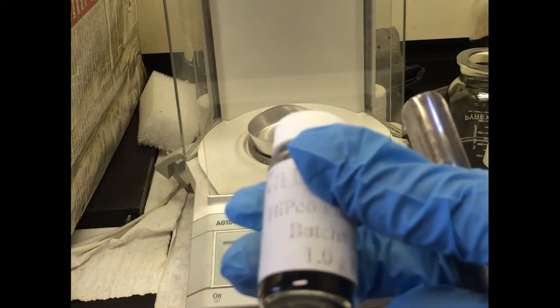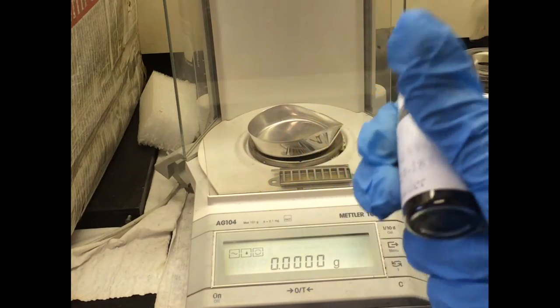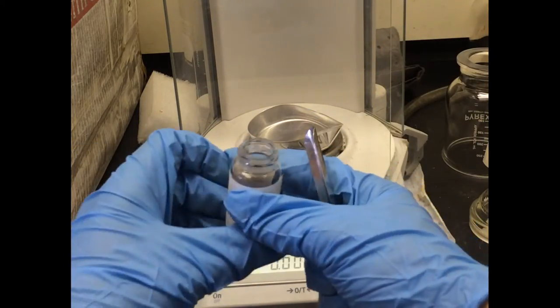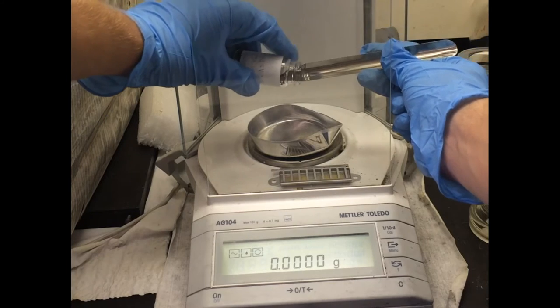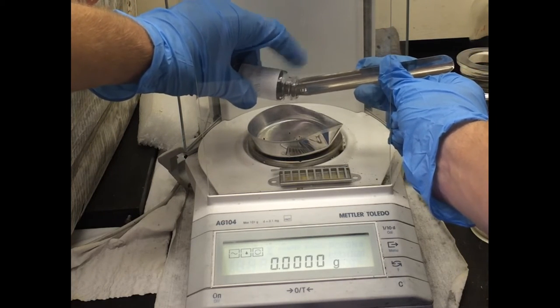This video will show the process of creating adsorption felts, or Bucky papers. New felts are created using powdered single-walled carbon nanotubes. The powder as shown here is weighed into approximately 50 milligrams.